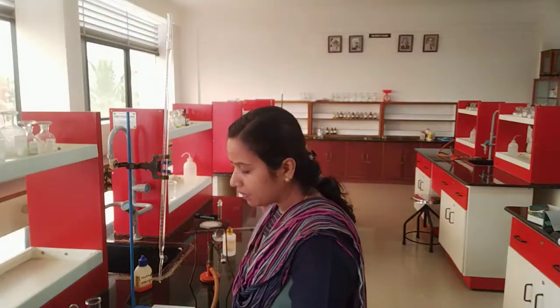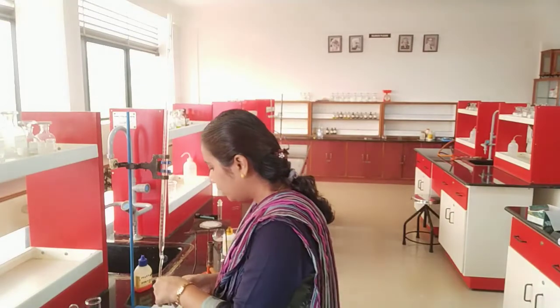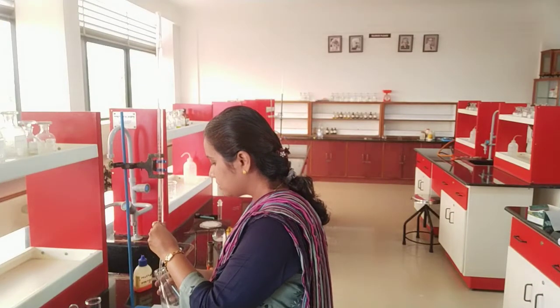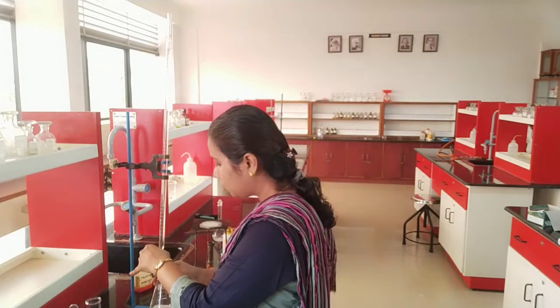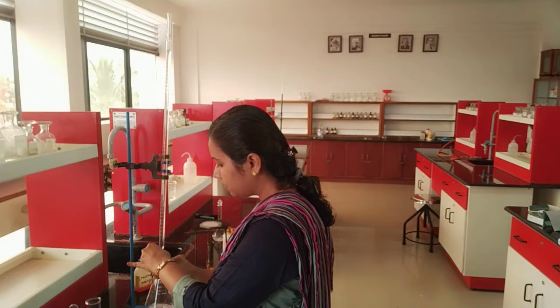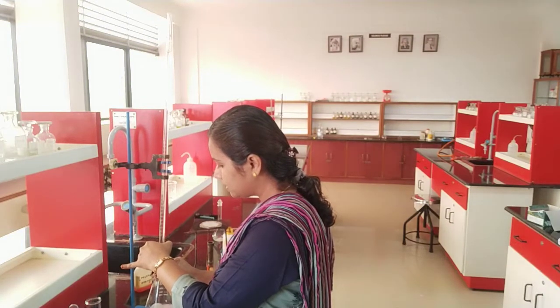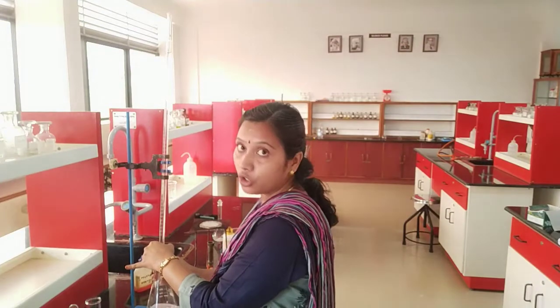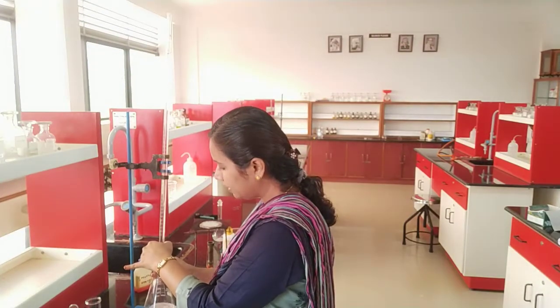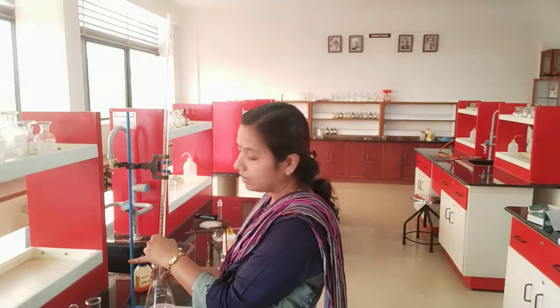So I am going to start my titration. My titrant is oxalic acid. My conical flask has sodium hydroxide along with indicator. So I have to open the stopper and drop by drop I have to allow it. In the left hand side and the right hand side I should be mixing the contents. I have kept the volume as 0. 0 is the initial reading. Once the end point is reached, I need to observe my final reading.